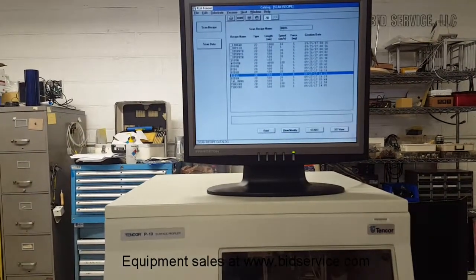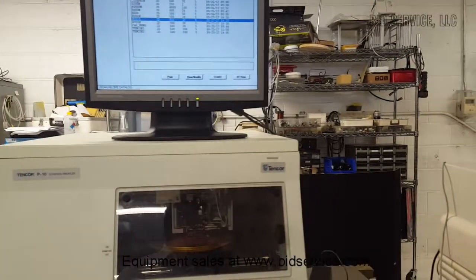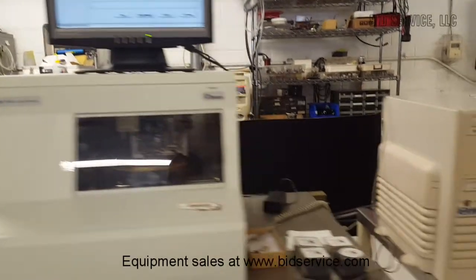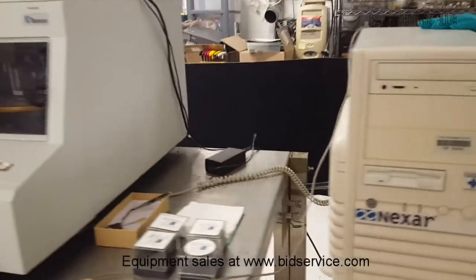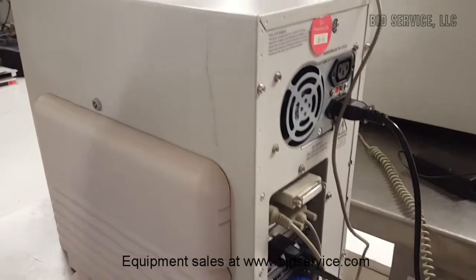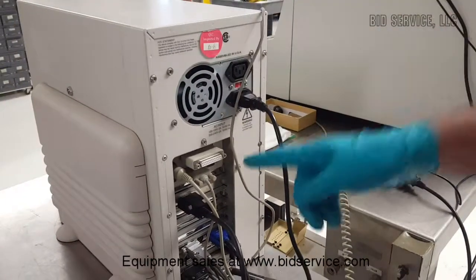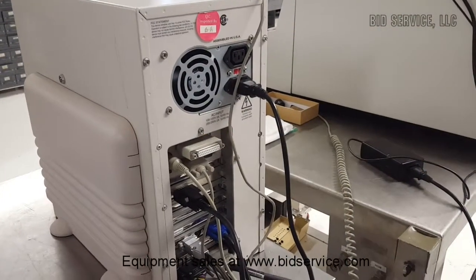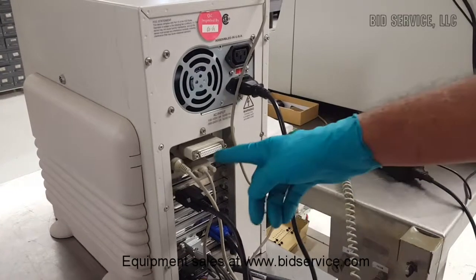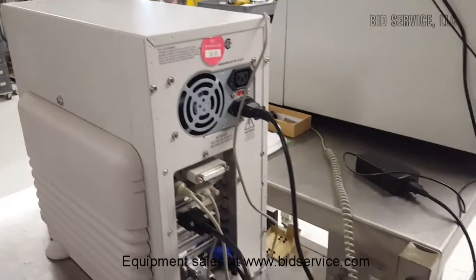So the system has an interface board in the computer here, and this machine is fully powered from the computer itself. So there is no separate power to the profiler, and this is the computer here, and there's a dongle here with a semiconductor chip on it on the printer port. Without this dongle, the system won't operate.